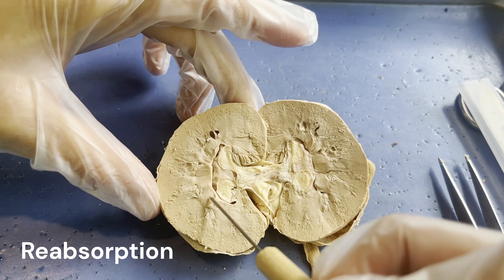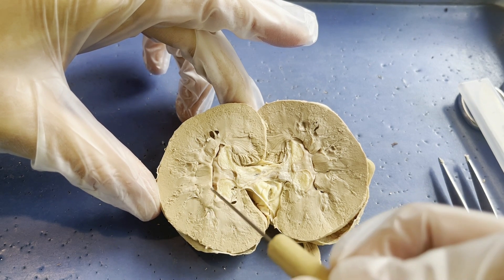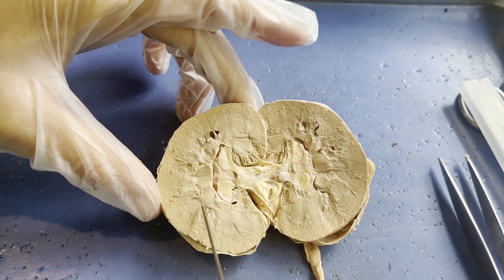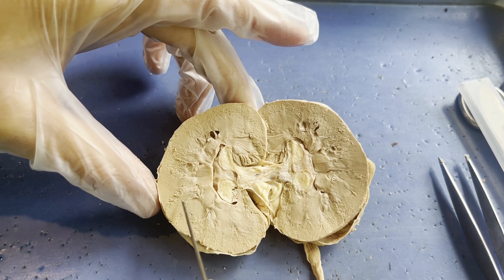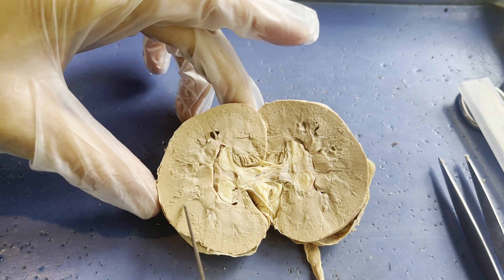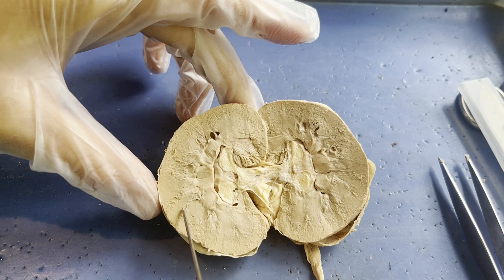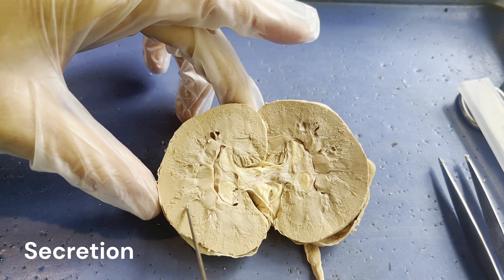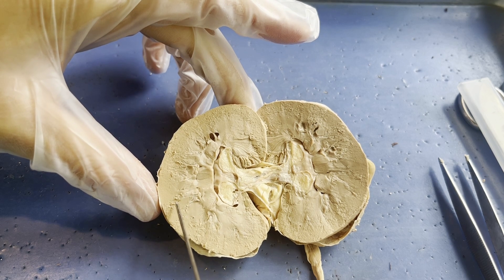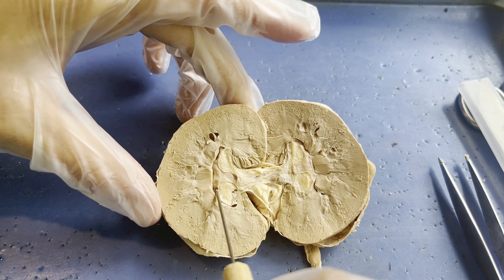During reabsorption, the kidney says the Bowman's capsule removed too much water and nutrients, so the body reabsorbs that excess water and nutrients back into the blood to keep the good stuff. The filtrate comes down the loop of Henle and then back up after reabsorption. At this point it's essentially urine, and it reaches the distal convoluted tubule back in the renal cortex — where the nephron has one final chance for waste in the blood to get dumped into the urine through secretion. Then the distal convoluted tubule becomes a collecting duct, and these collecting ducts take urine from multiple nephrons down the renal medulla into the next region.